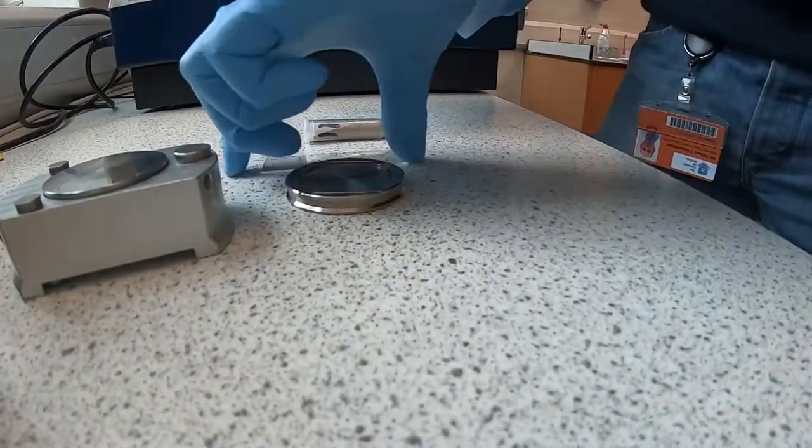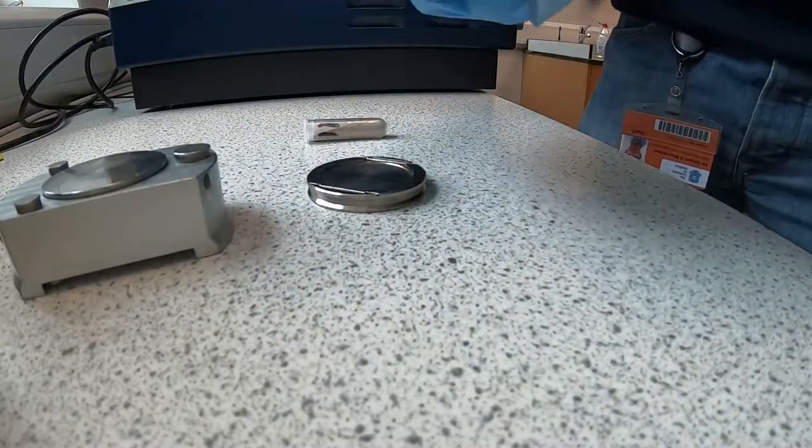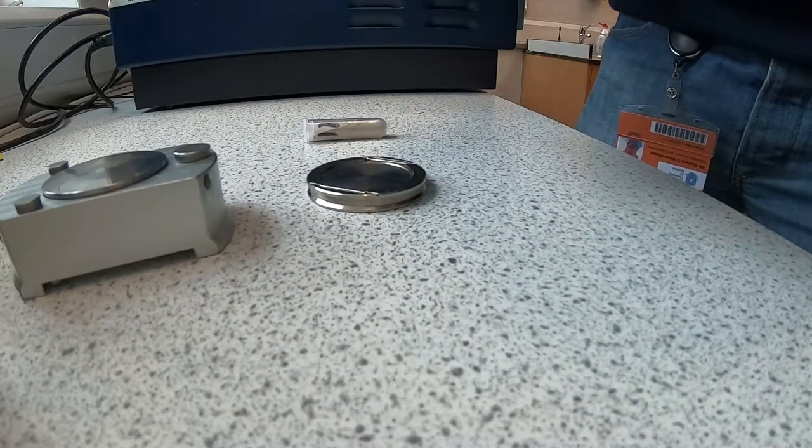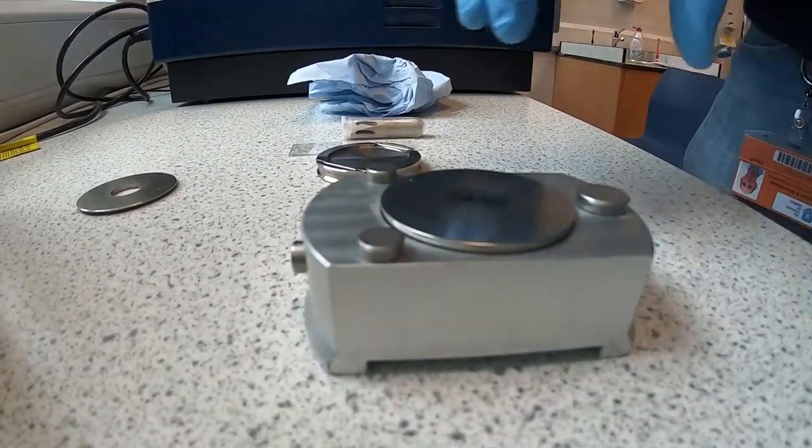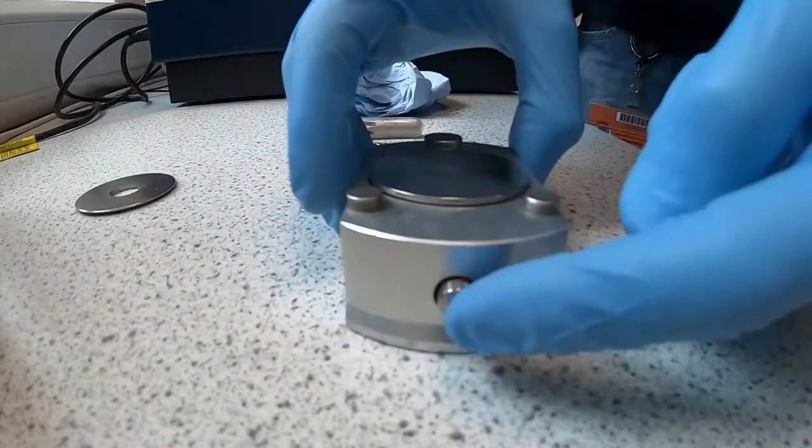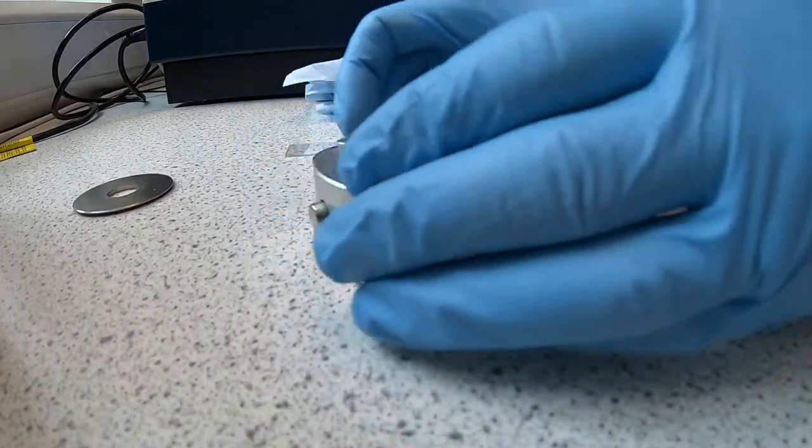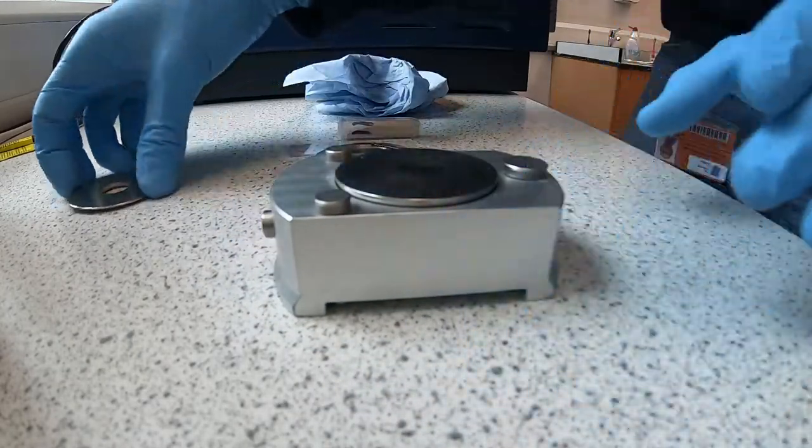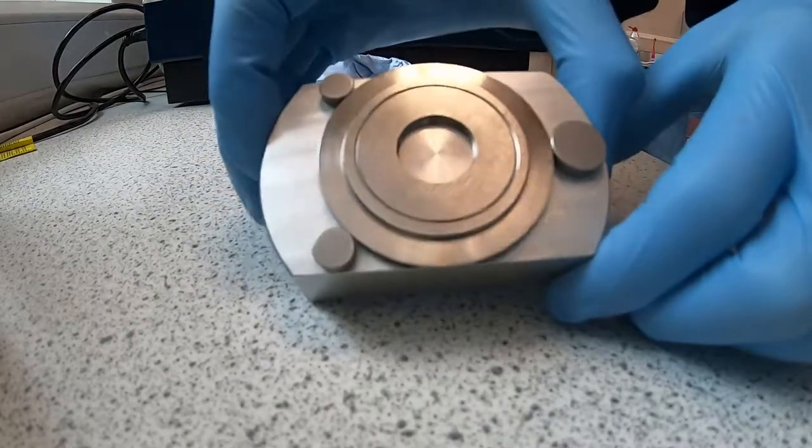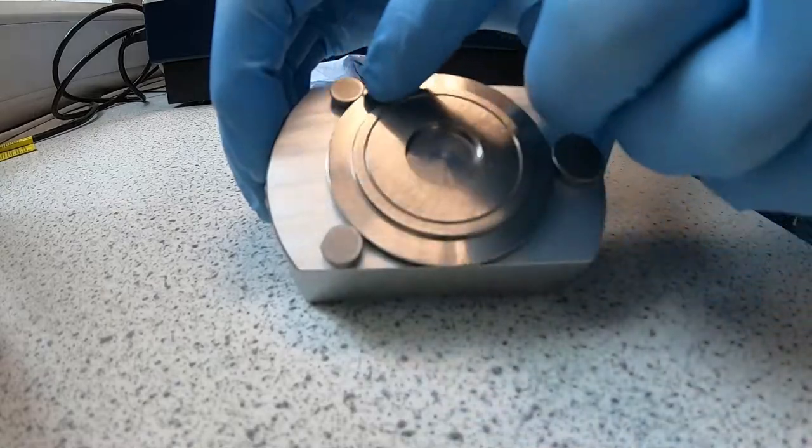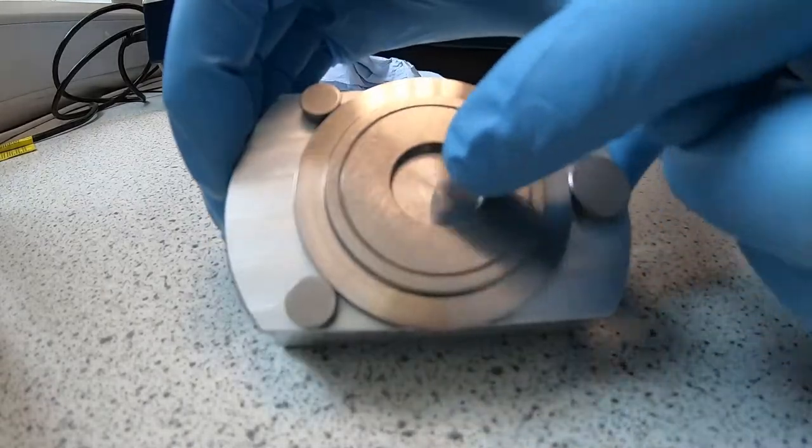I'm going to open and clean my glass slide. Now everything is cleaned. So with this, there's a little button here you can see. I push it, it makes this bit move. When you do that, you can push it to open it and put your sample ring in there. It's got to be in this orientation with the outer section here. I'm going to put powder in that hole.